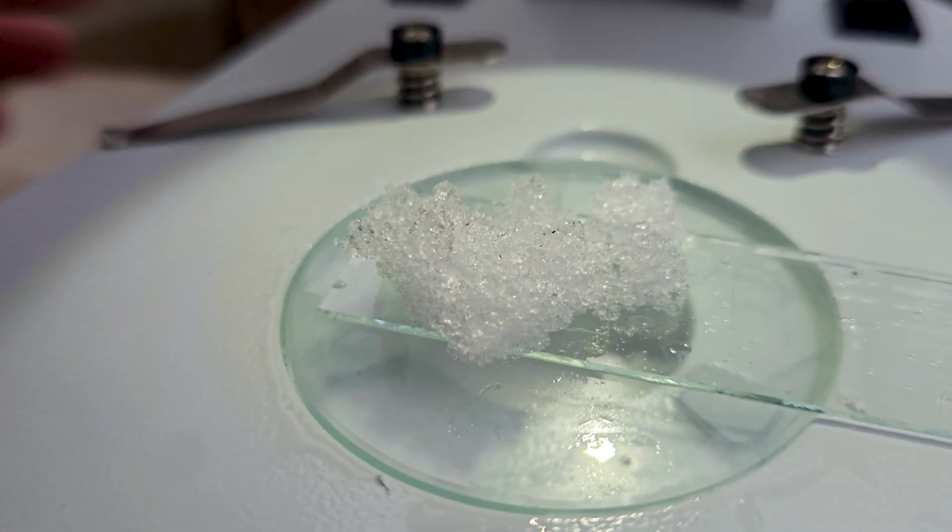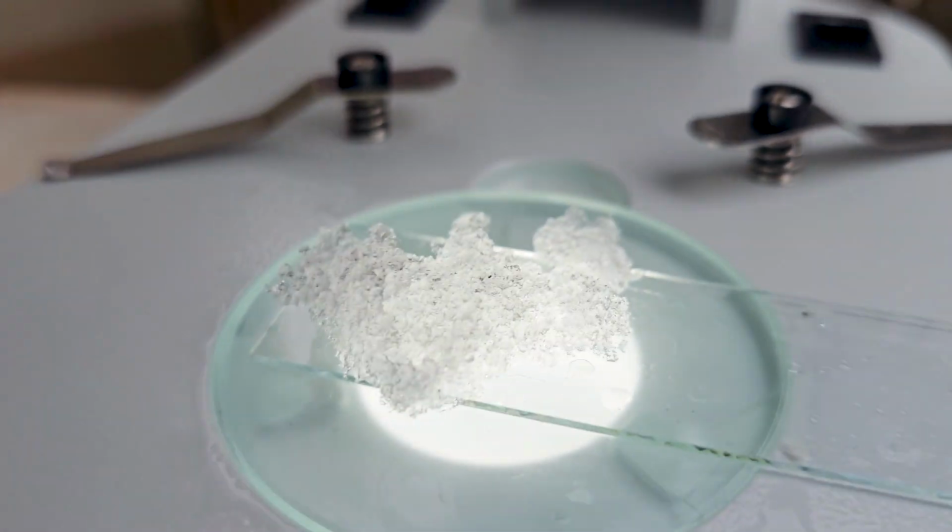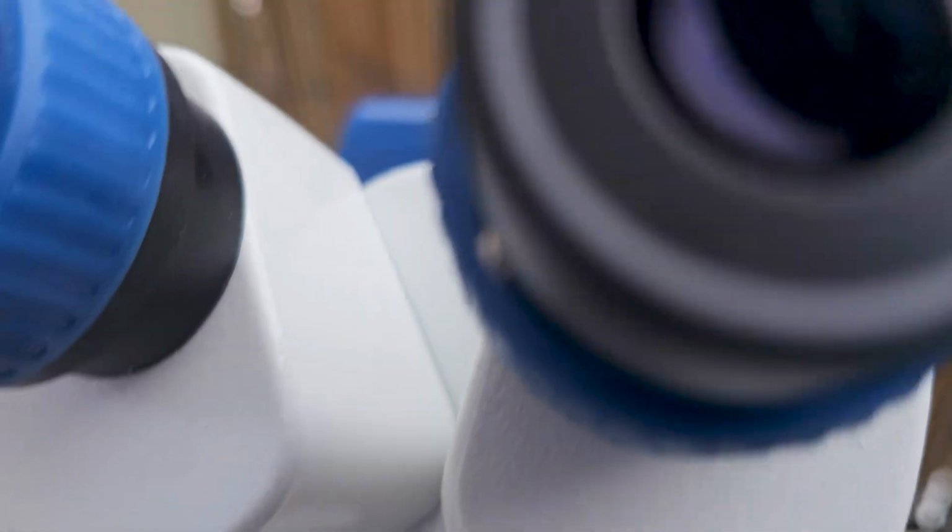Once snowflakes reach the ground, they quickly lose their original shape. They break, partially melt, and often freeze again. Now we'll take a closer look at snow that I collected directly from the ground and examine it under a microscope. Instead of perfect snowflakes, we see more compact ice. Under the microscope, it looks incredible, like an abstract painting made of irregular structures, cracks, and shimmering ice surfaces.